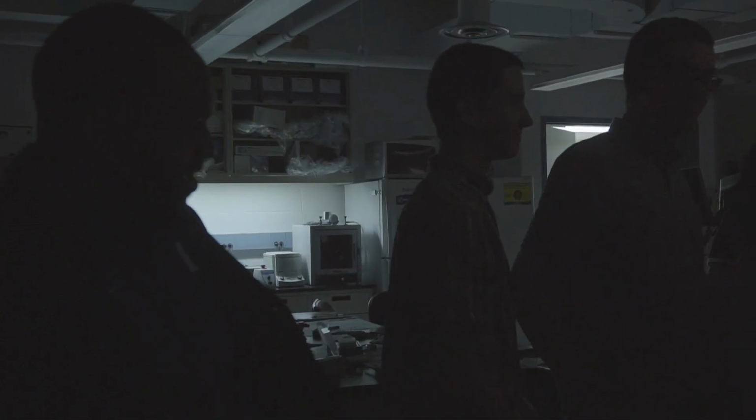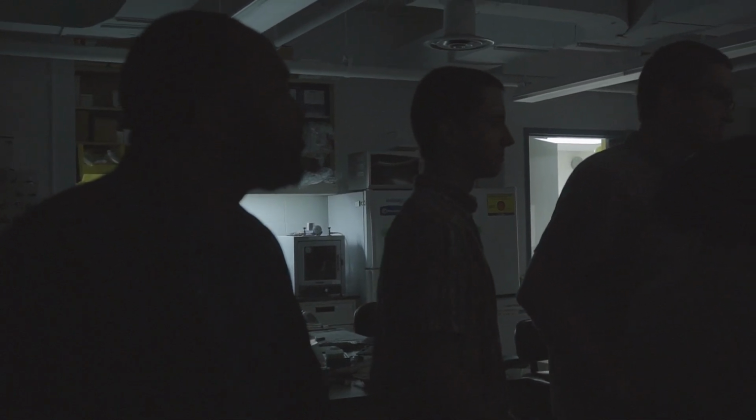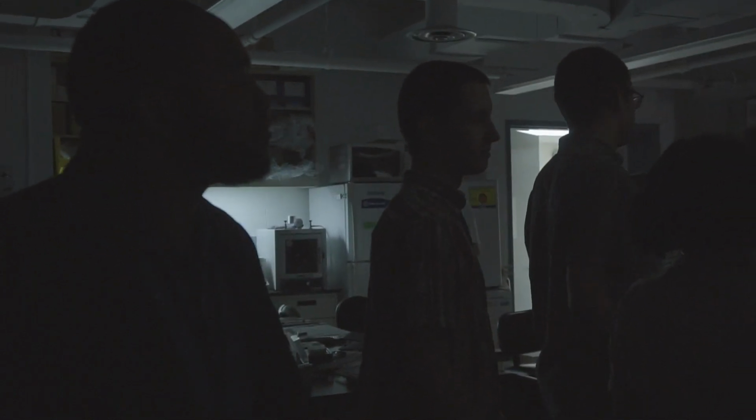There are cameras and machines where you just take a picture of it, and if I was going to show this in a presentation, where all my bands were, I would just pump up the brightness on the computer. But you just really need to be able to see it enough to be able to punch out your DNA. This is a better ladder too. Group B, you can come look at yours as well. So you don't even know yet if you actually see it, really? You're going to know if it's right or not. I don't recommend the flash, personally.